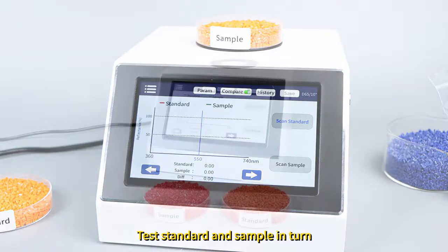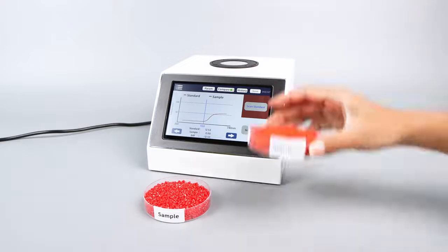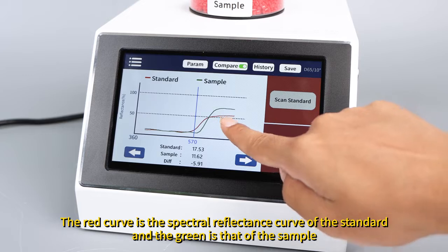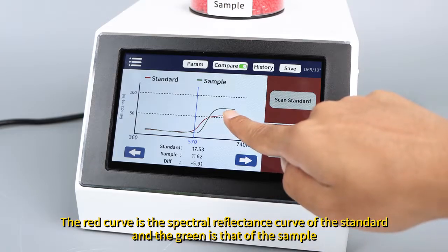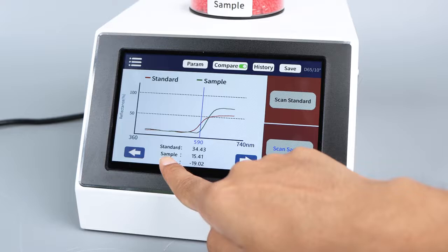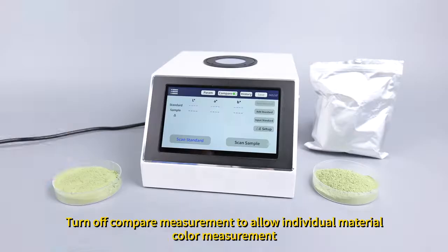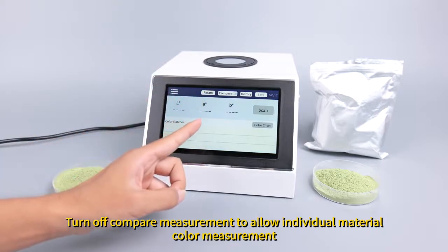Test standard and sample in turn. The red curve is the spectral reflectance curve of the standard and the green is that of the sample. Click on the left and right to view the spectral reflectance for specific wavelengths. Turn off Compare Measurement to allow individual material color measurement.